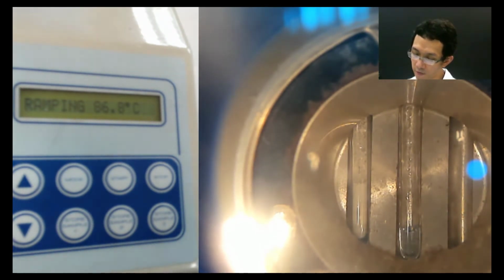Hannah, later on you give me what temperature range? 81 to 83. Okay, later I will write it on the table that I have. But now we are waiting for Y.